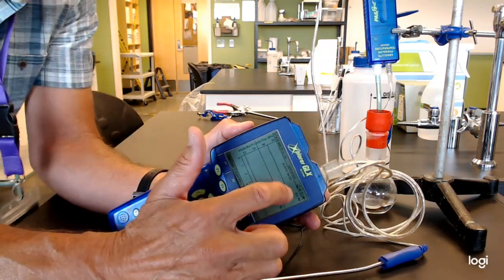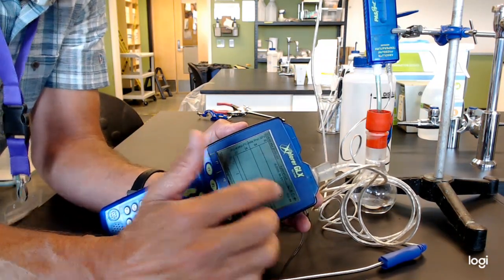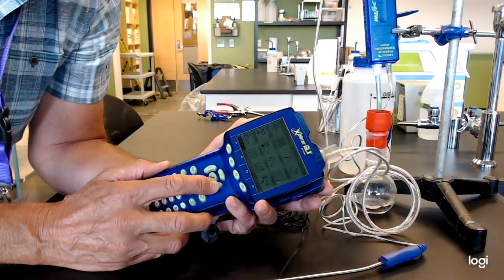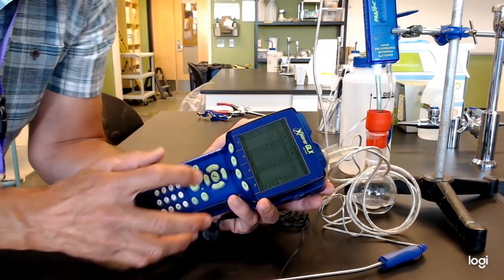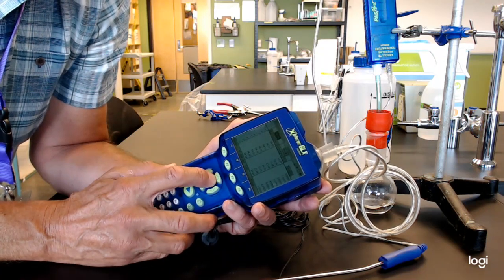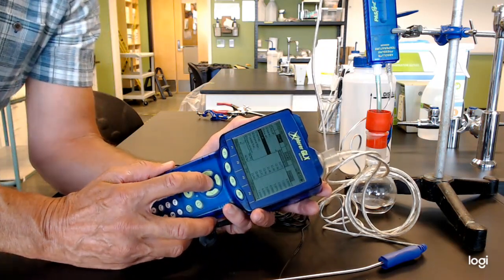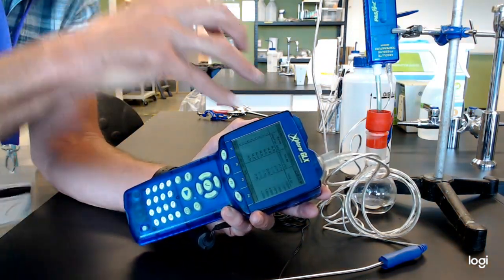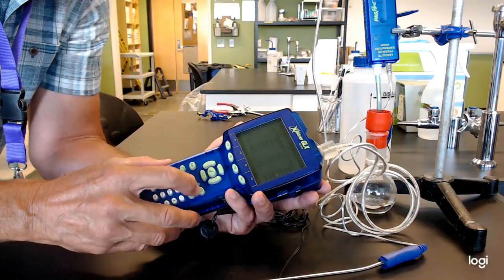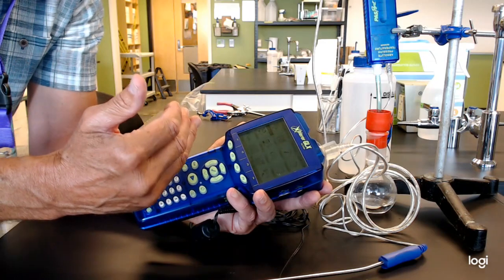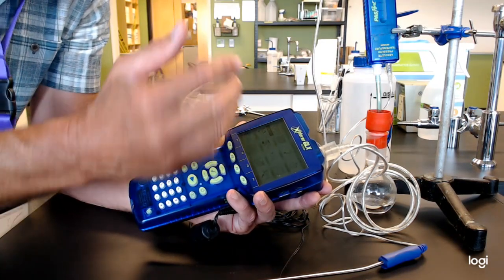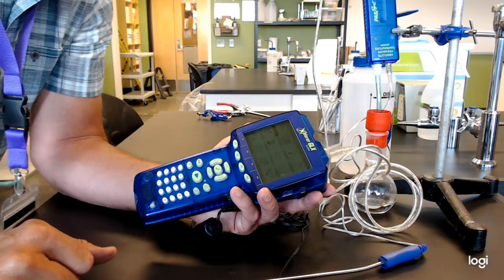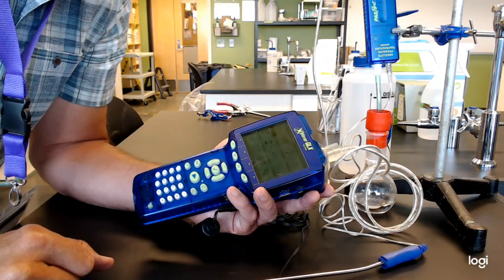By the way, if you can see the run number, it now says run four. So it kept track of the other ones. If I home page out and go down to the data table, at the top it says run two. I'm going to highlight it. I can pull up the run four data in table form automatically. So the idea is that the data is on the data logger. These screens, in essence, are saying how would you like to look at that data now in table form or in graph form. So that's helpful. And this just might be better for some students conceptually when they're watching it.